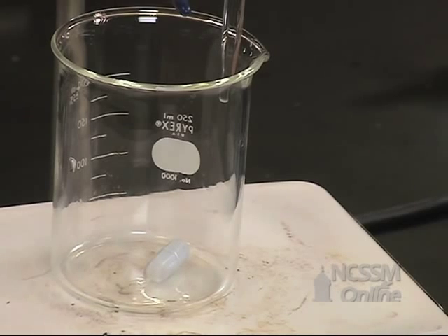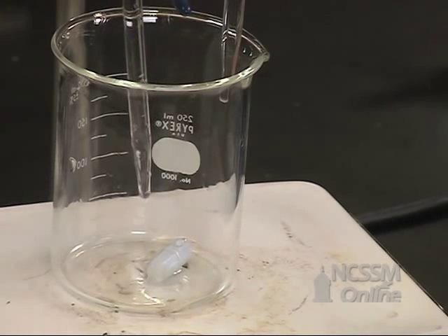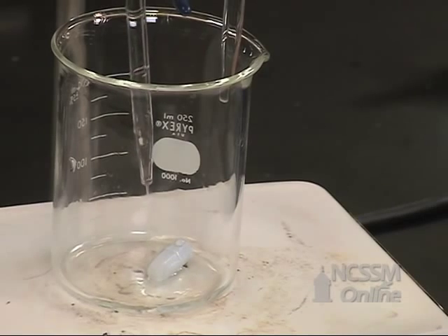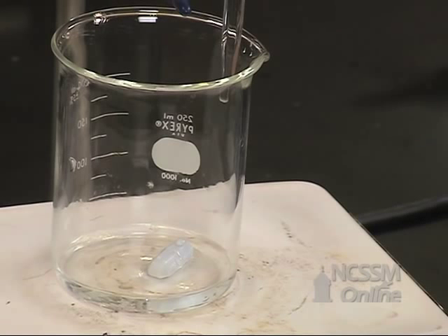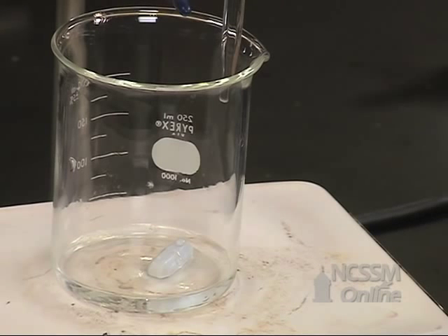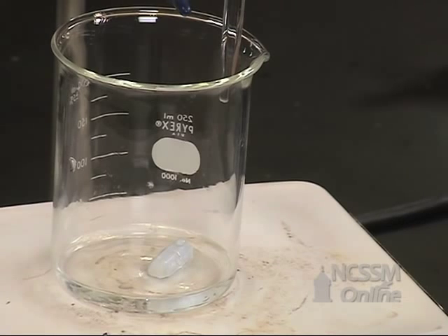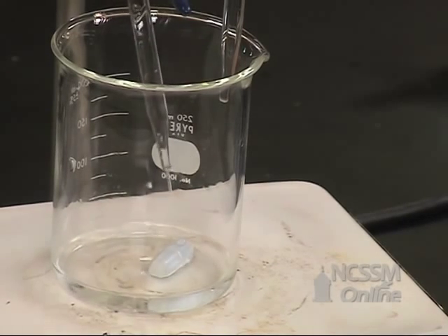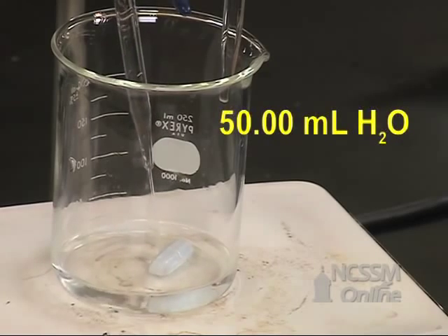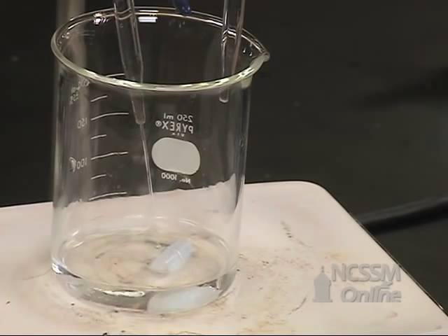We're going to pipette 10 milliliters of a phosphoric acid solution. We know the volume and the molarity of the phosphoric acid, so we'll know the number of moles of phosphoric acid that we're using. We're also going to pipette in 50 milliliters of distilled water to give us enough volume to do our titration.